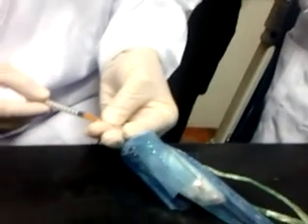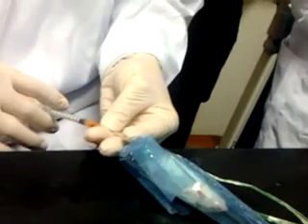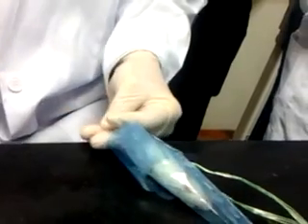Place it parallel to the vein. You can see my finger holding the needle, it doesn't move. If I let go of my hand, the needle is still there with the syringe. I tilt it a bit, the needle goes into the vein. I pull my plunger, blood in the hub, let go of my thumb, and push in the medication drop by drop. But the one already out is already out. It doesn't sleep. I have to take a few more. Okay. Once you do it, you do it one more time.